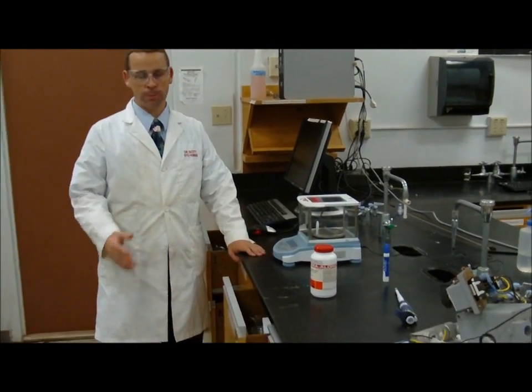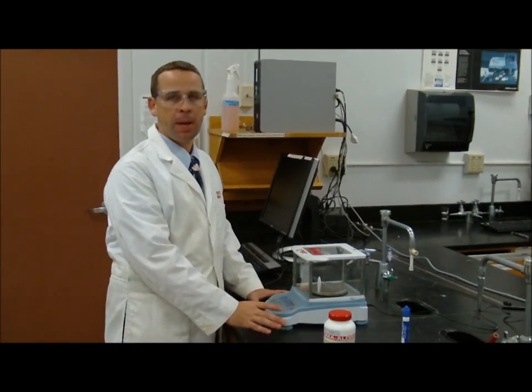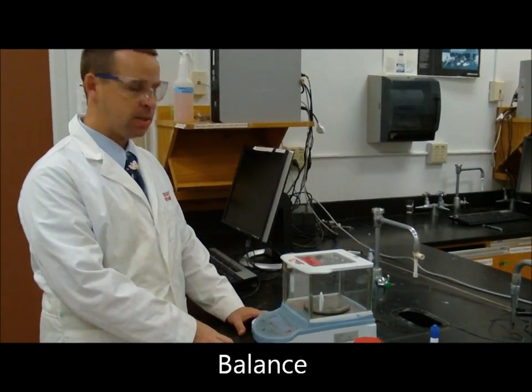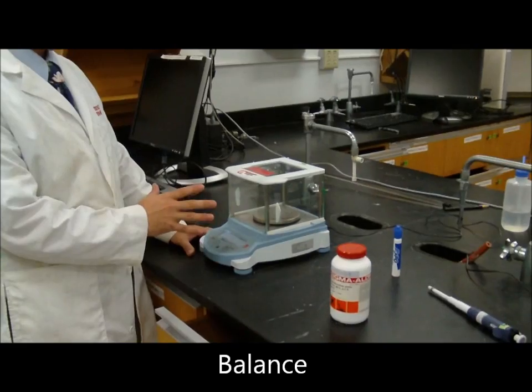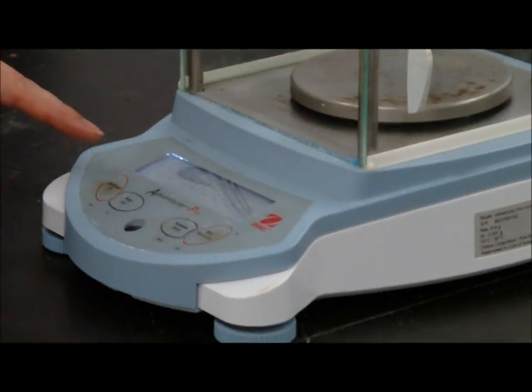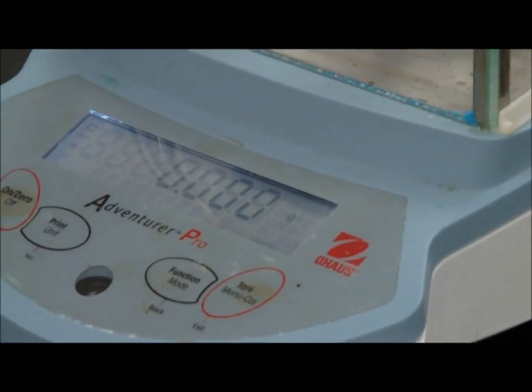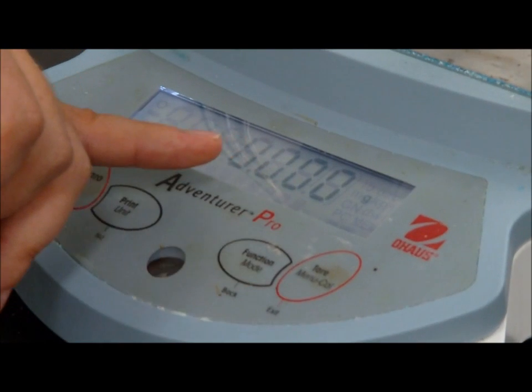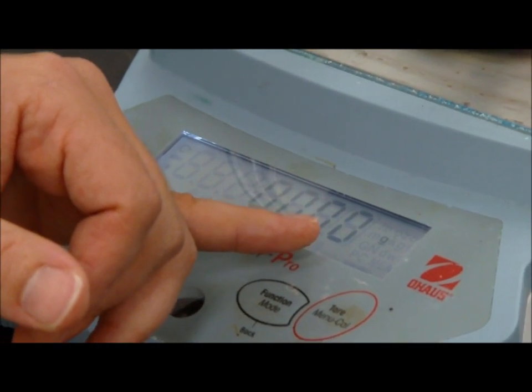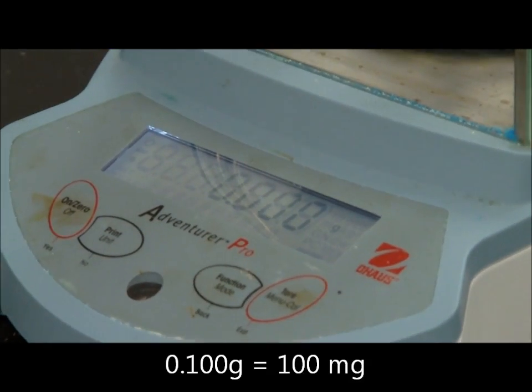All right, so working in the laboratory, we're going to rely a lot on our balance, okay? The balance, we want to keep clean. We want to make sure that we are using it properly. As you see here on the display, it tells us our mass in grams. We have 3 decimal places. Therefore, this number here is the number of milligrams. So if we have 0.1 grams, we have 100 milligrams.